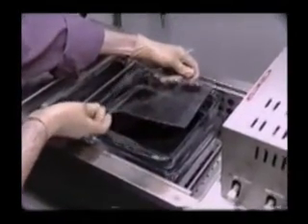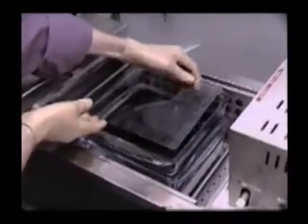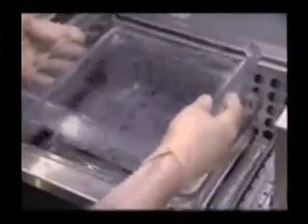A blue dye that stains only proteins helps us visualize these bands. The bands from the sample of known standards will be our yardstick for comparison. By comparing how those proteins run to how your samples run, you can get a rough idea of the molecular weight of your samples. Proteins of like molecular weight will be at the same level in the gel.